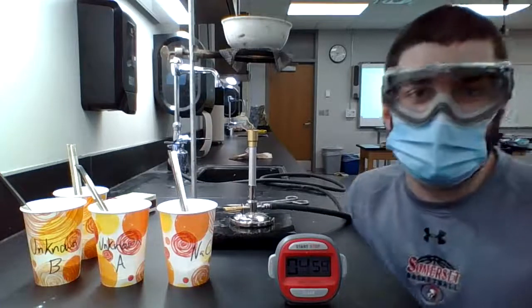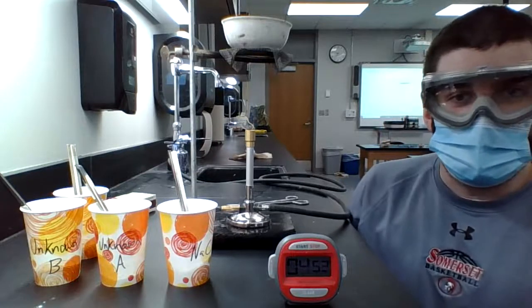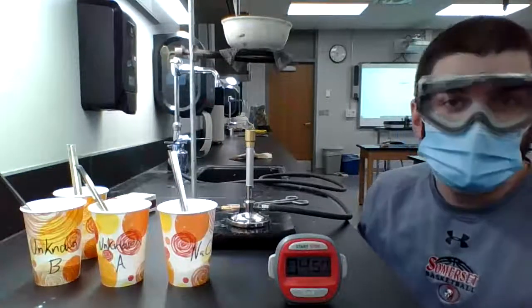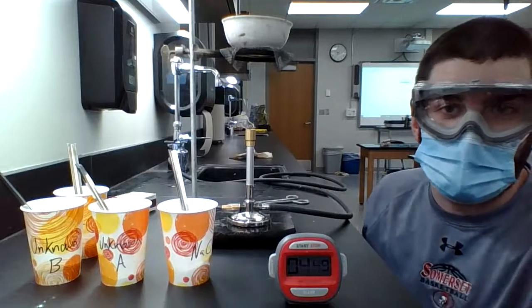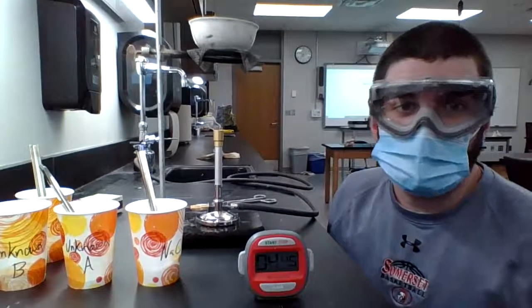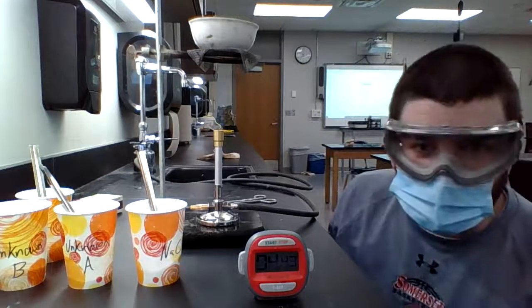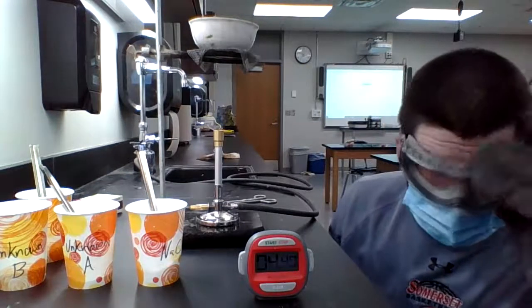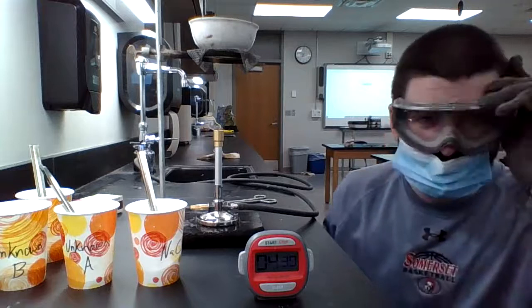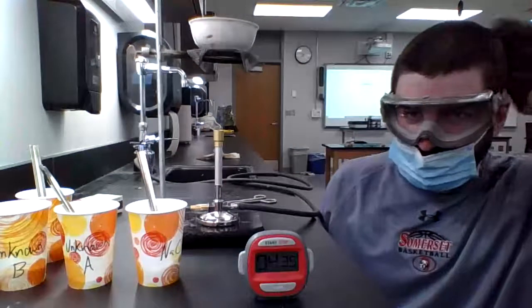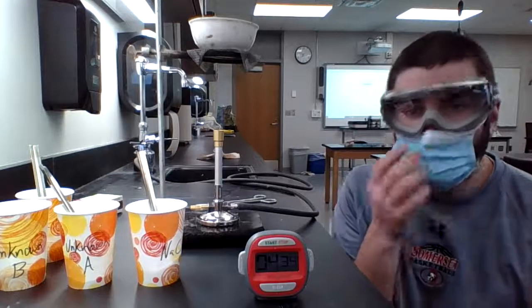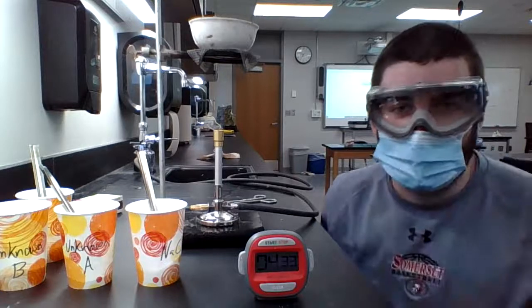All right. So I just finished cleaning up our setup. So we have salt, which is ionic compound, which is now up in our evaporation dish. And I've got my timer running down there, which I think you can see. I will let you know what time we are done with this one in a moment. So I'm going to pause it and I'll let you know.